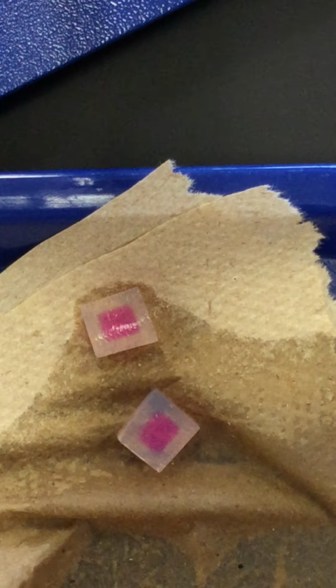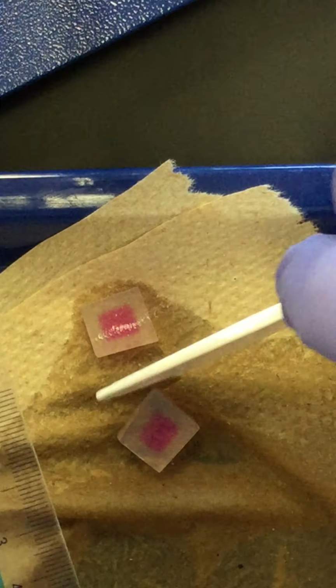And the first measurement we're interested in is the depth to which it has penetrated. So there's that measurement. So record your best estimate of that measurement.